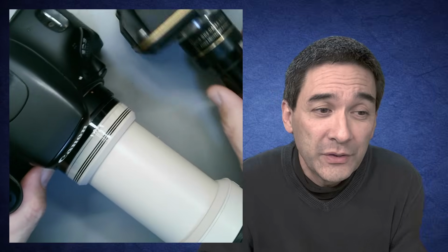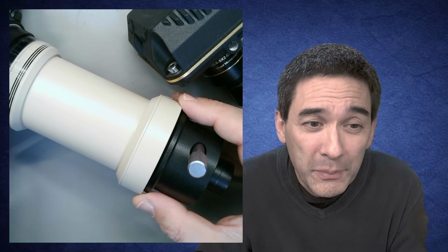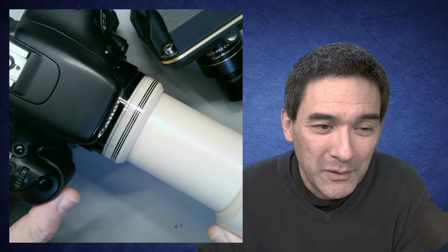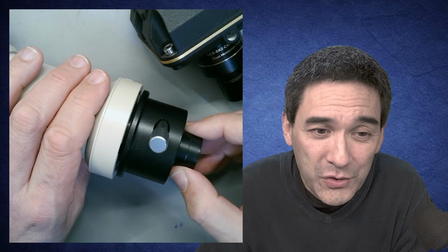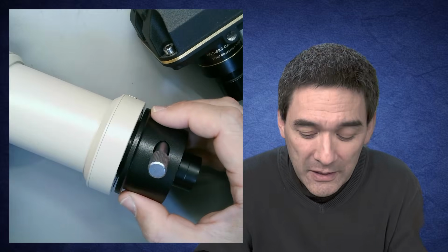Over here I've got a DSLR camera adapter from the company Olympus. That's one that's not manufactured anymore. It's a huge device, as you can see, but so is the camera. It too has some optics over here that can be inserted into the microscope. But the magnification is quite a bit different, and I will explain why this is the case.